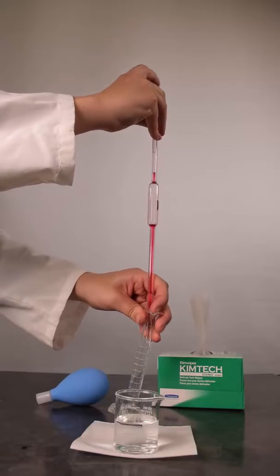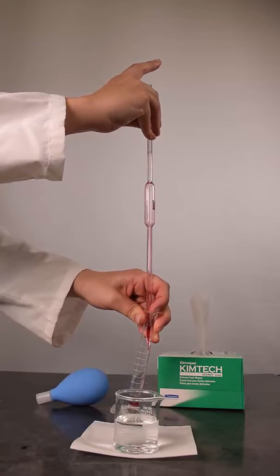Drain the rinse solution. Here, we drain the rinse into a graduated cylinder to show the volume of rinsing used.